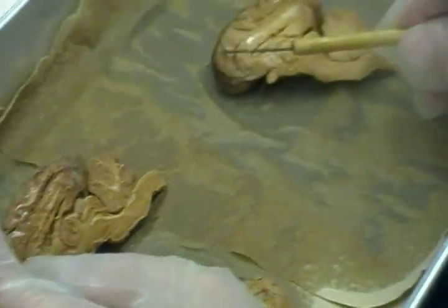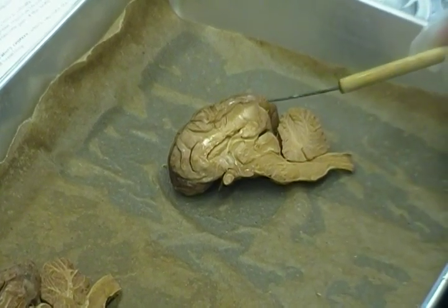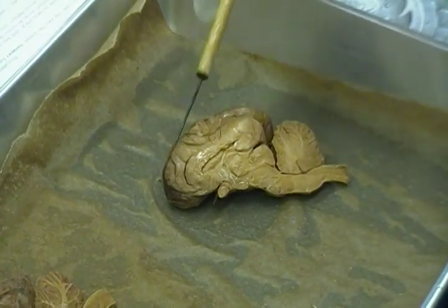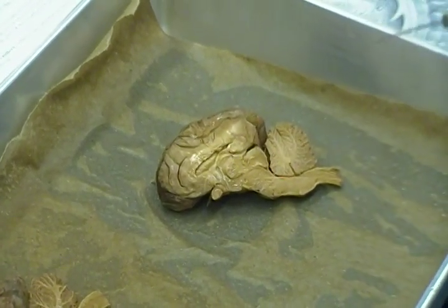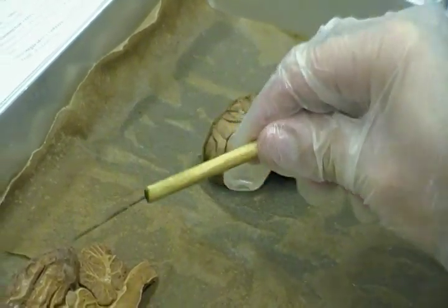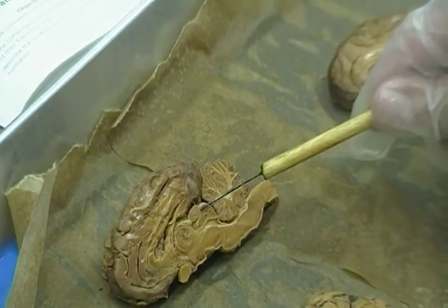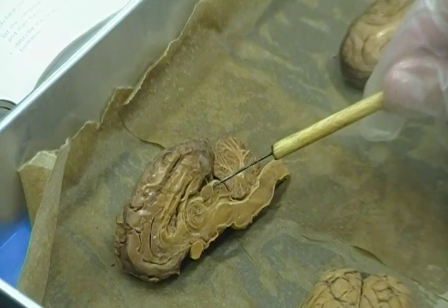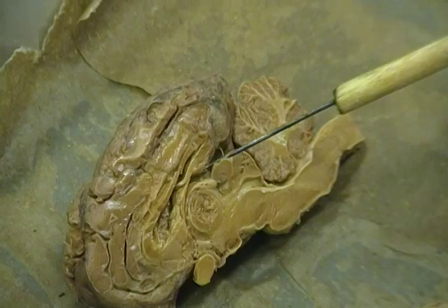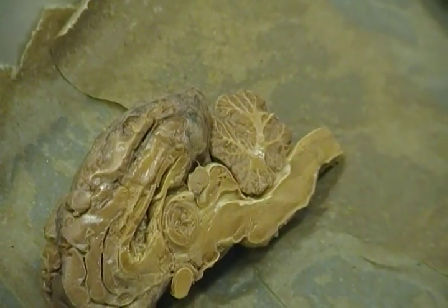Okay. What lobe is this going to be? Frontal. What lobe is this going to be back here? That's going to be occipital. We really can't see a whole lot more in terms of lobes from sagittal section on here. But there is one more thing we can see on here. That is this organ right here. That's actually, well, it's partly a gland, and I'll give you a hint. It produces melatonin. The pineal gland, exactly.